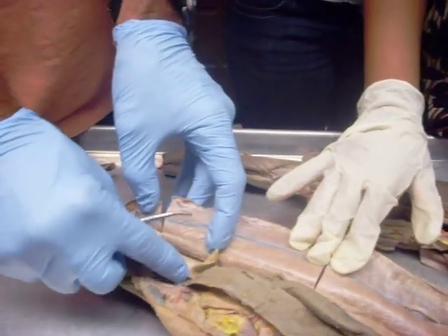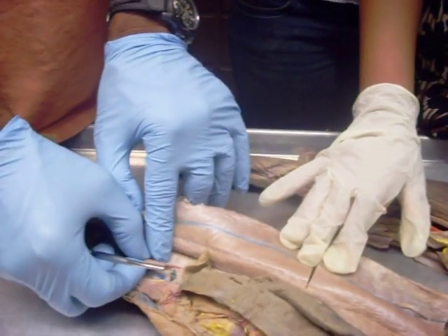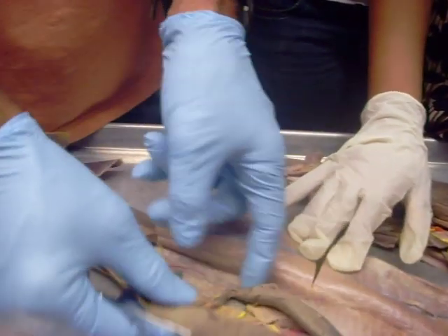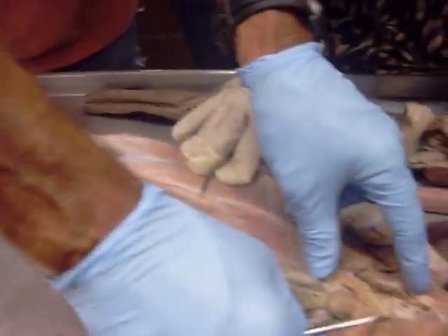Did I give you the rectal artery? This one right here? Probably not. Okay, let's go over here.